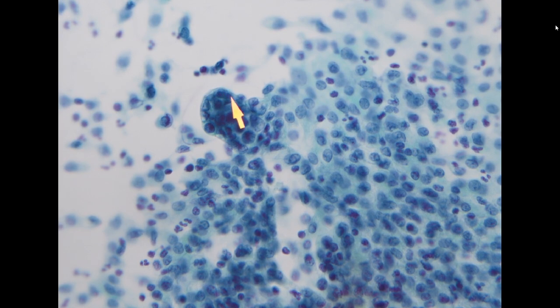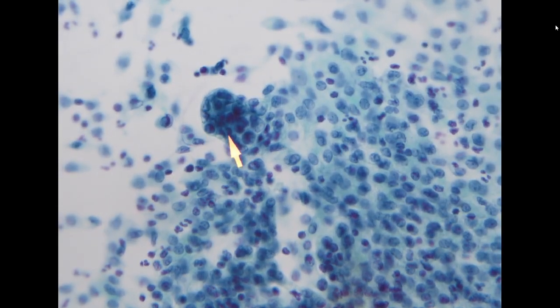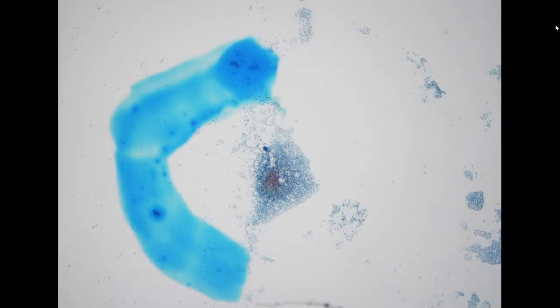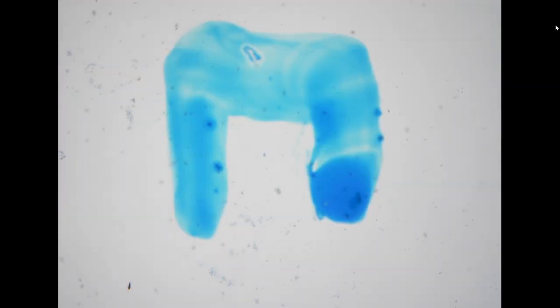So here you can see, even though the cell is very small, you have some irregular nuclear membrane, three-dimensional architecture, and increased NC ratio. So this is an adenocarcinoma. The lesional cluster is very scant. It's not very easy to detect, but our cytotech managed to pick up some cells. And here you can see a little bit of orange color inside the cytoplasm, suggesting mucin, which is also consistent with pancreas adenocarcinoma.